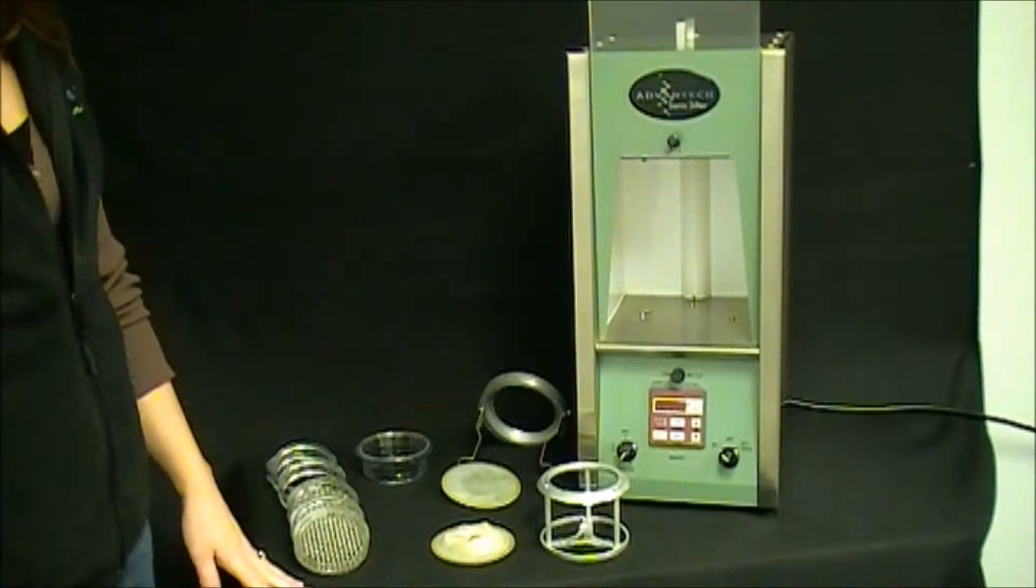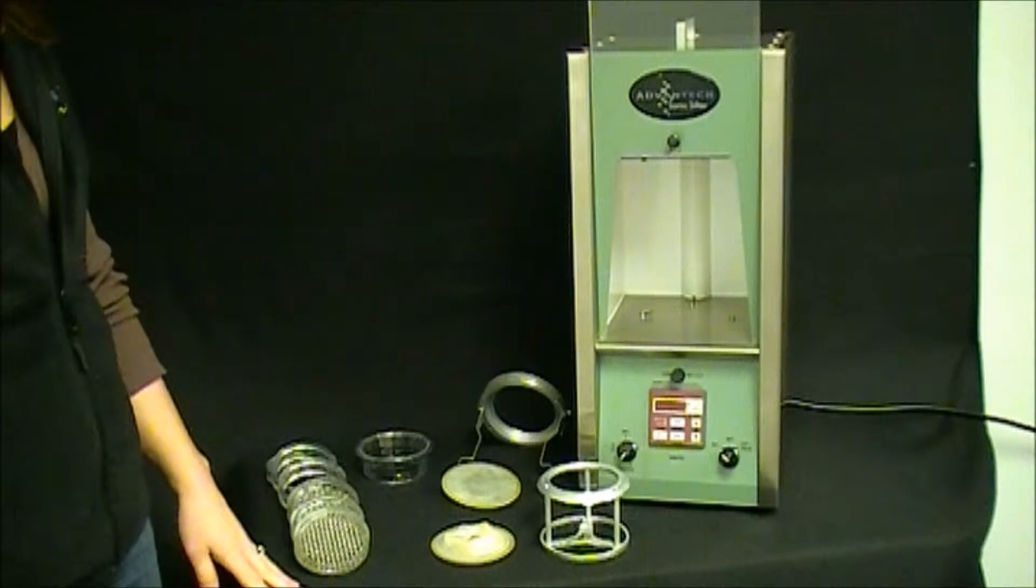In this video I'll be demonstrating how to properly build and insert the test stack for your Advantech L3P Sonic Sifter.